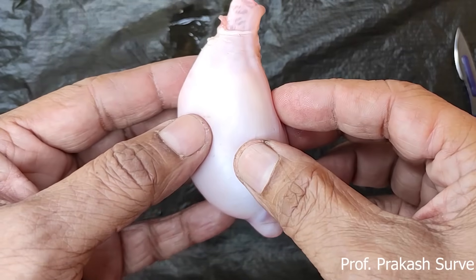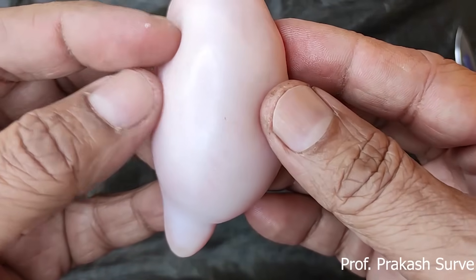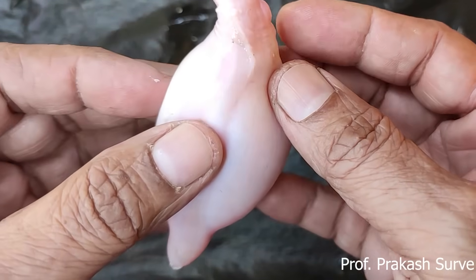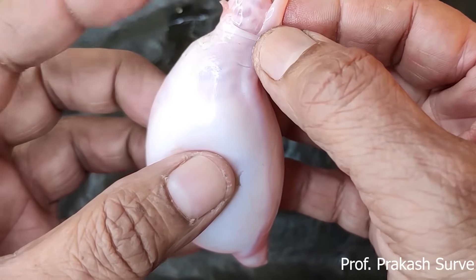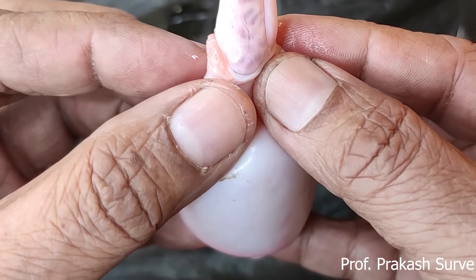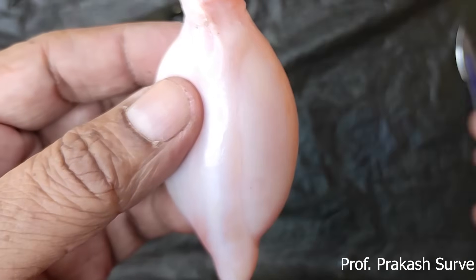The outer scrotum is removed. Inner to that, we observe that the external surface is covered by a collagenous connective tissue layer which is called the tunica albuginea. The spermatic cord is also there. This is fully covered by the tunica albuginea.